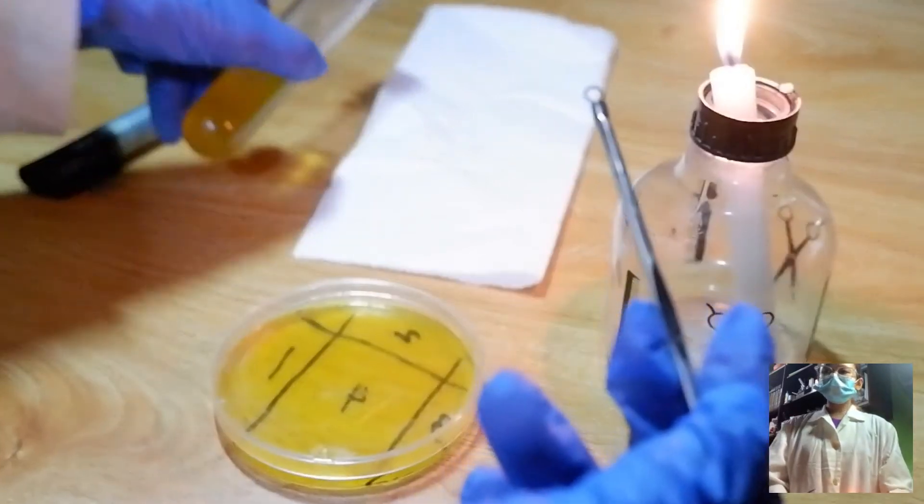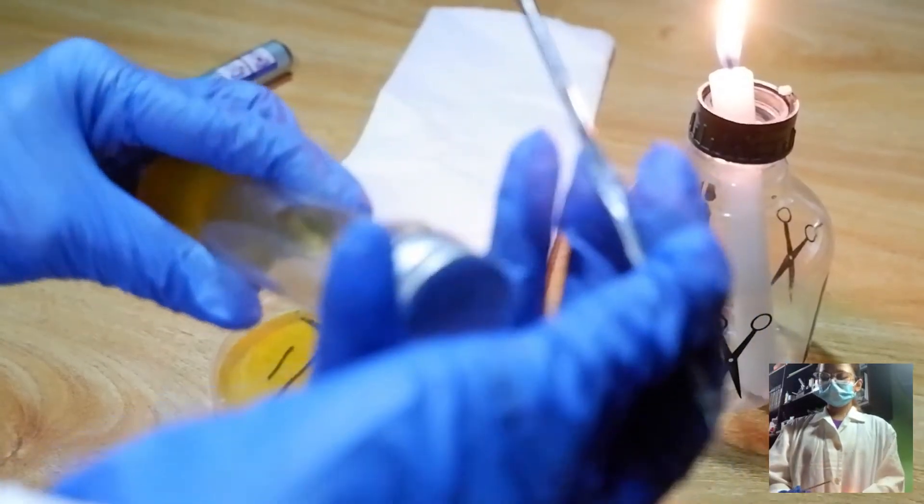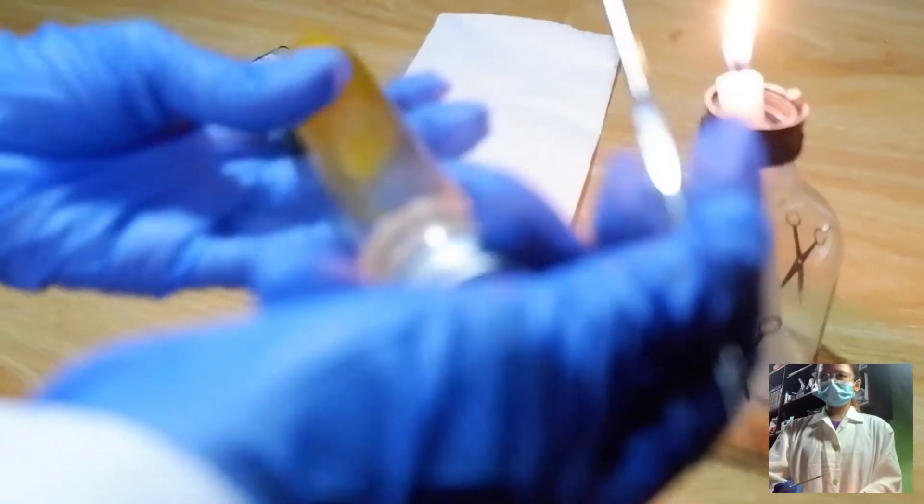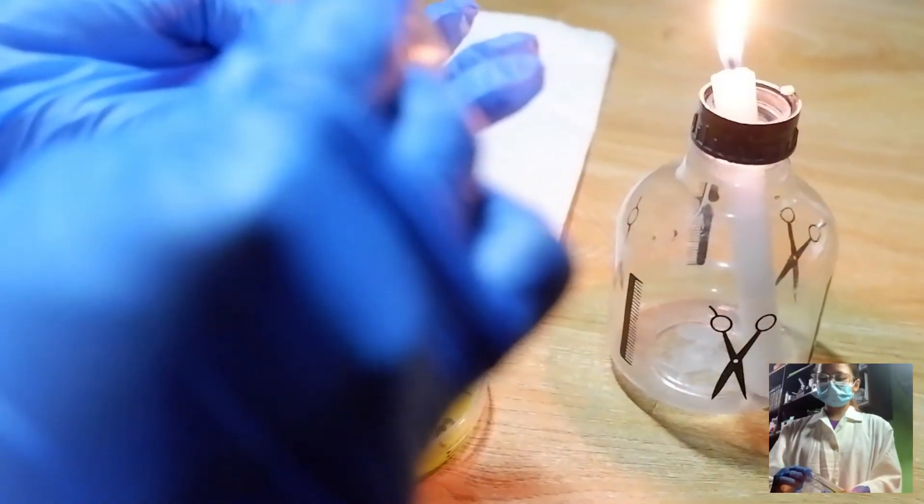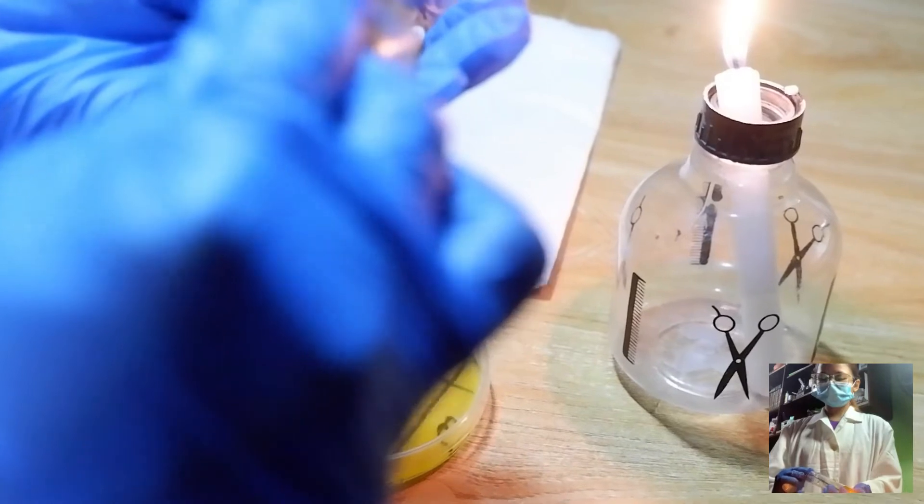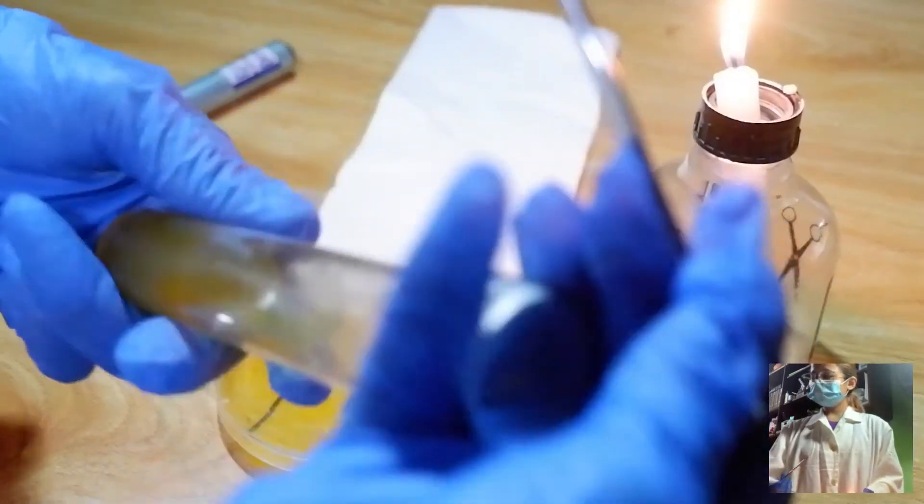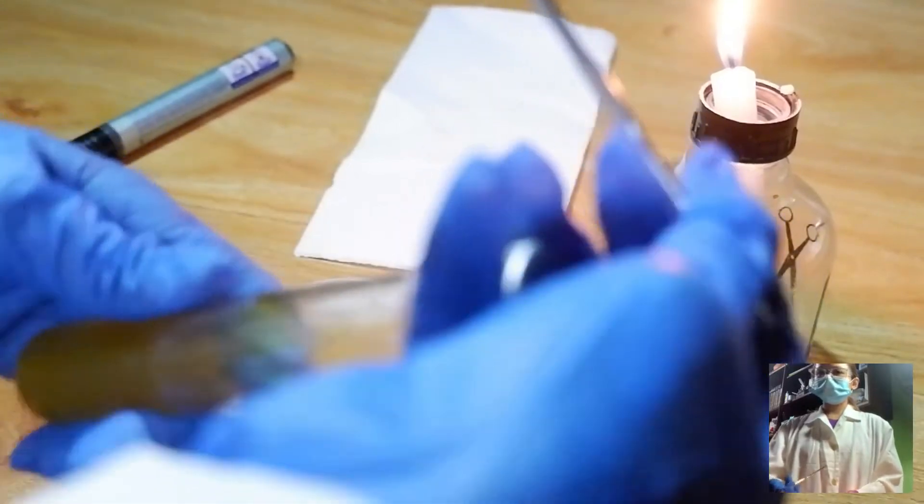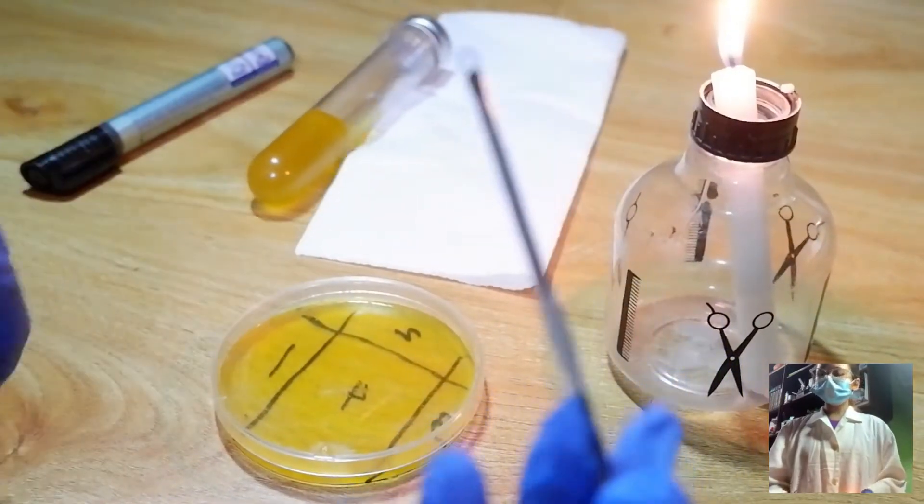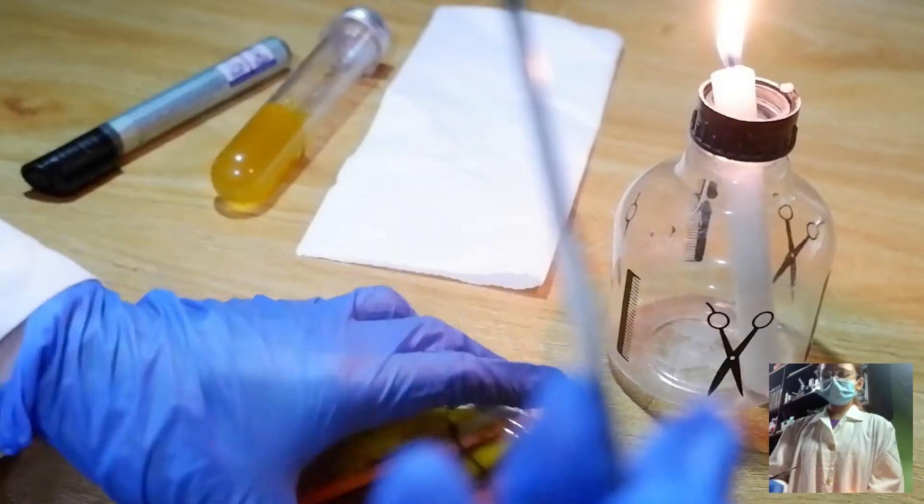We will get our sample, recap it, and inoculate it to our agar plate.